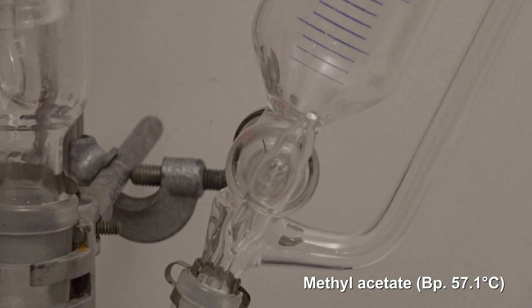This is just about getting a good distance to the boiling point of methyl acetate, but also prevent that the reaction becomes too slow.